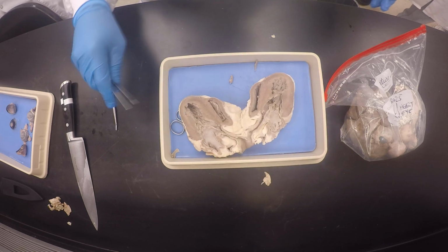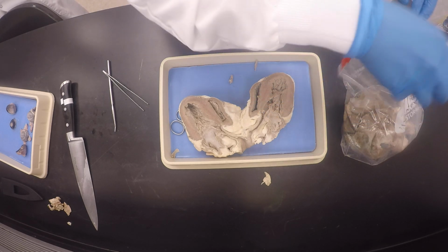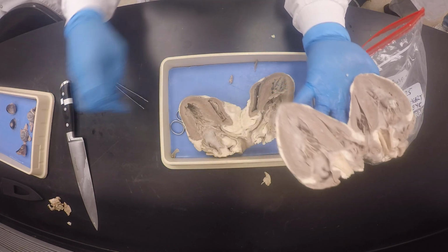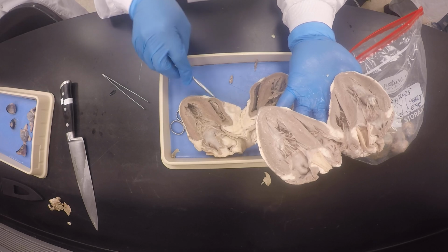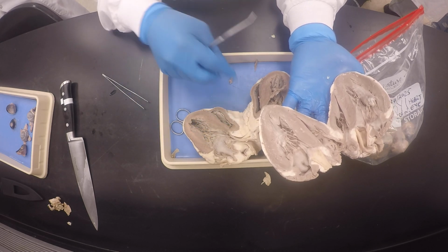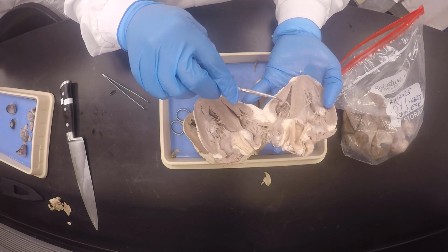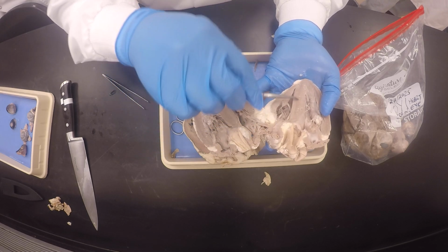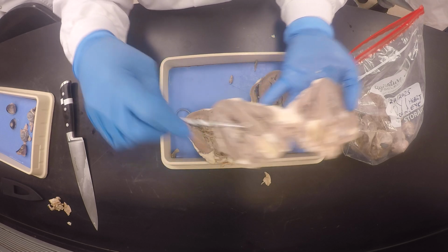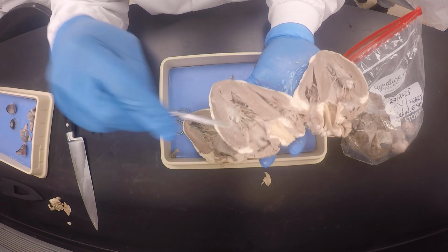Okay, so I showed you yesterday when this heart was a lot better. Voila! Do you see from yesterday? Isn't that coolio? This one, we just cut it a little bit, but because there was this indentation here that kind of got me. If this one was a little bit away from there, I would have been able to cut nicely like yesterday. Look here. You see how the moderator band is attached to the papillary muscle here, and then it's attached to the interventricular septum. Do you understand? Do you see that? So you know this is the right ventricle. This one we cut through ours here. We didn't get so lucky. Okay, but this is what we got lucky with yesterday.